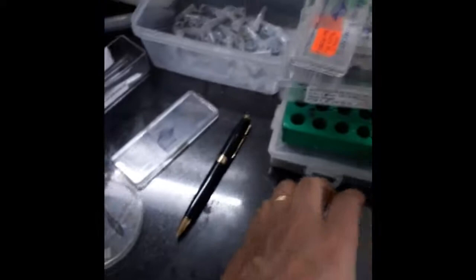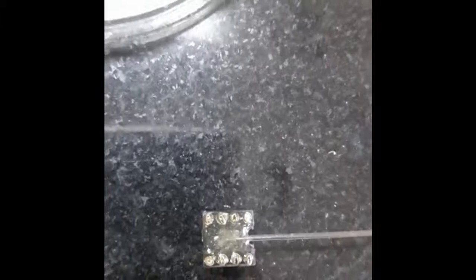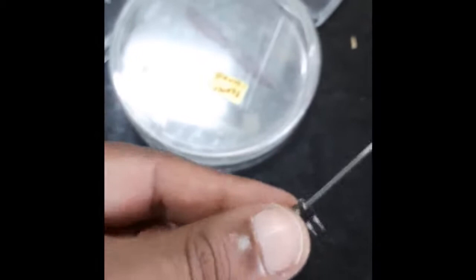For making extracellular recordings, we use particular kinds of electrodes which we fabricate in our lab. They are made of fine wire — up to 8 strands of fine wire, individually of the order of tens of microns. These wires are then connected to an 8-pin IC base, and that is what we use in our recording system. We will see how they are used for recording a little later.